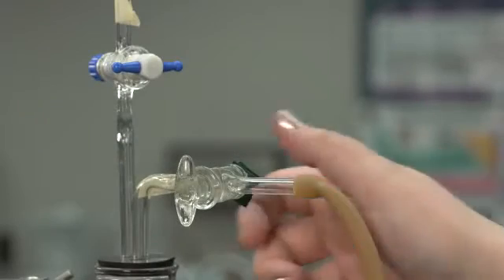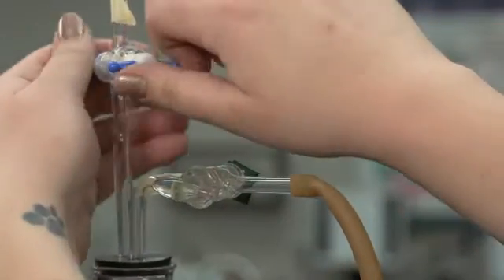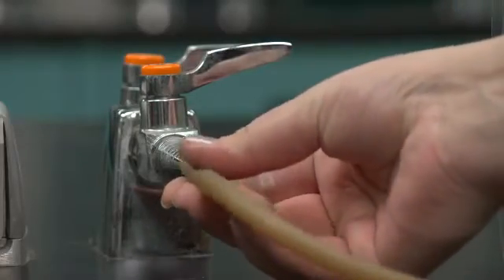To start, open both stopcocks. Attach the fill tube to the gas source.